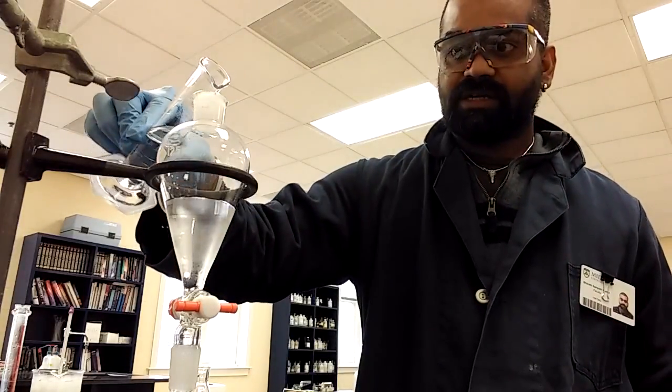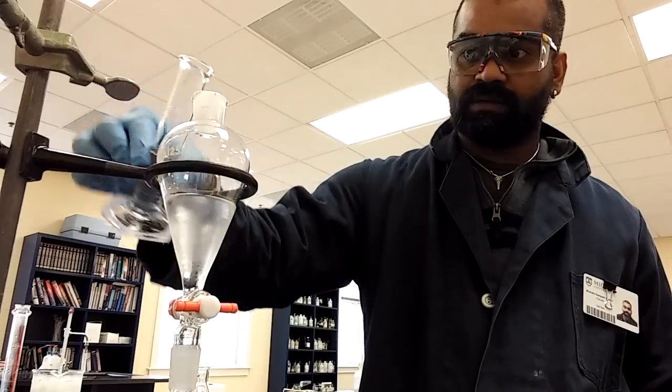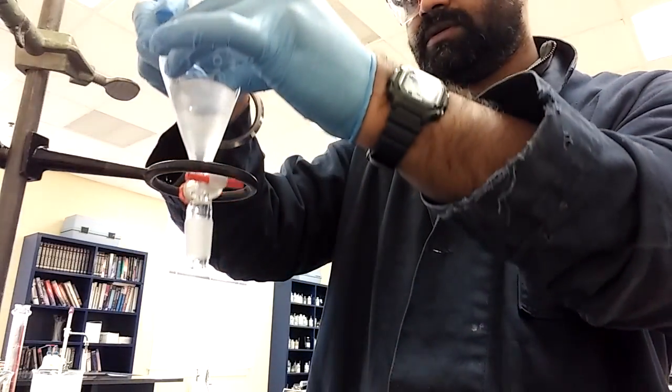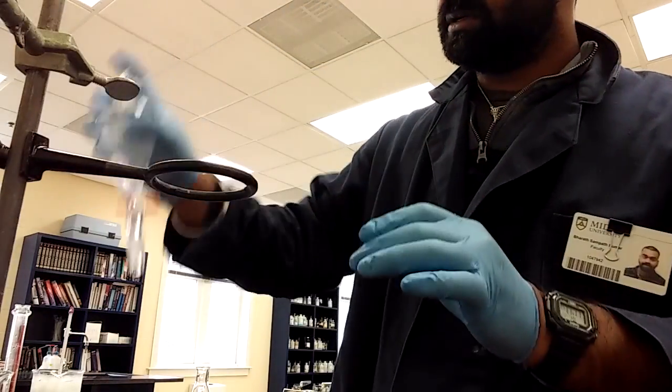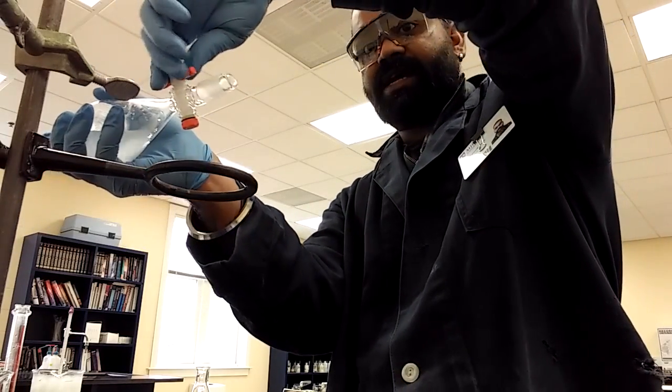All right, I'm going to add just a little bit. Okay, cap it off. Okay, holding the stopper, I'm going to shake it. See, hear that?